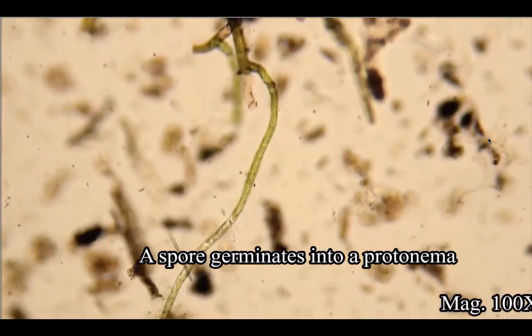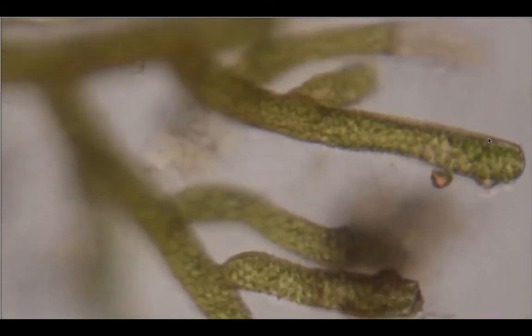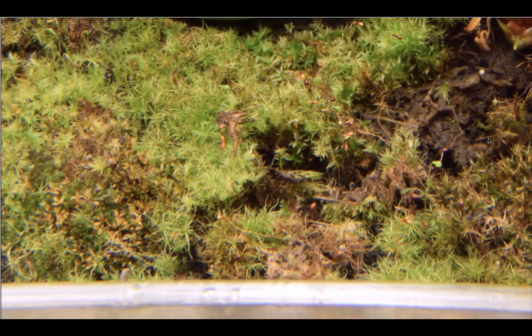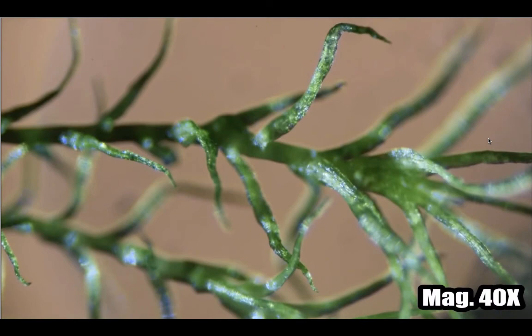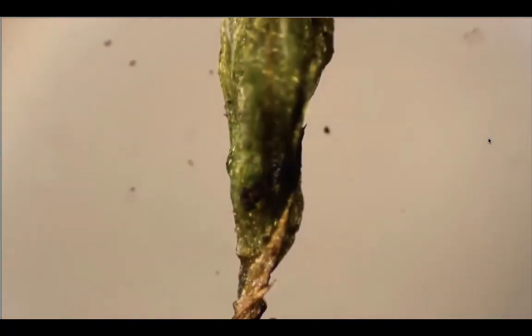Those are those kind of lines that you're seeing there. They're showing all the different gametophytes.